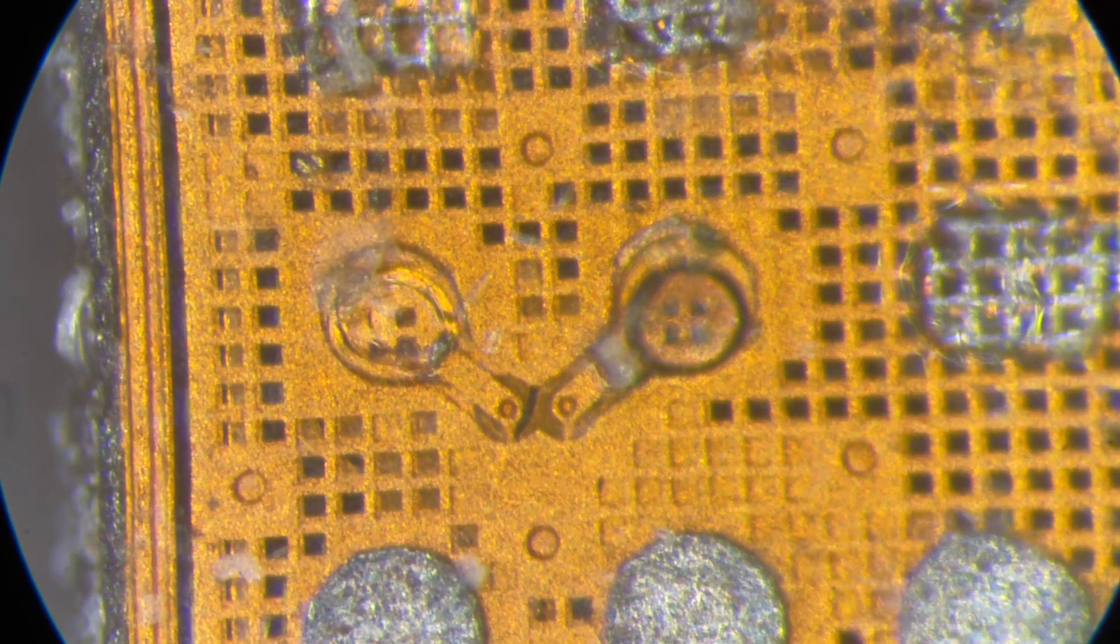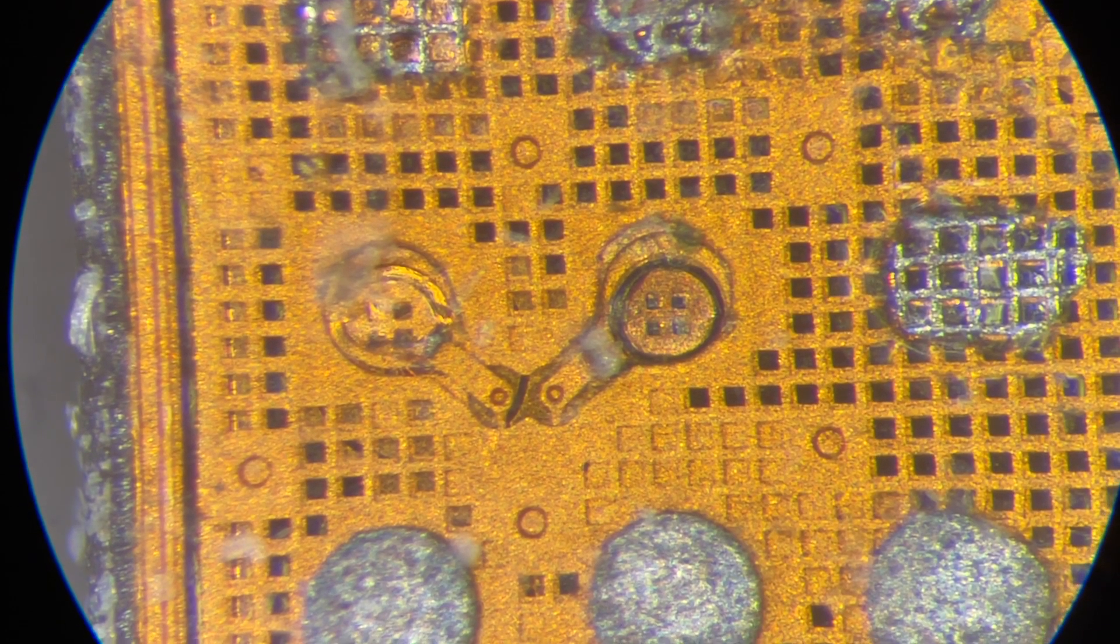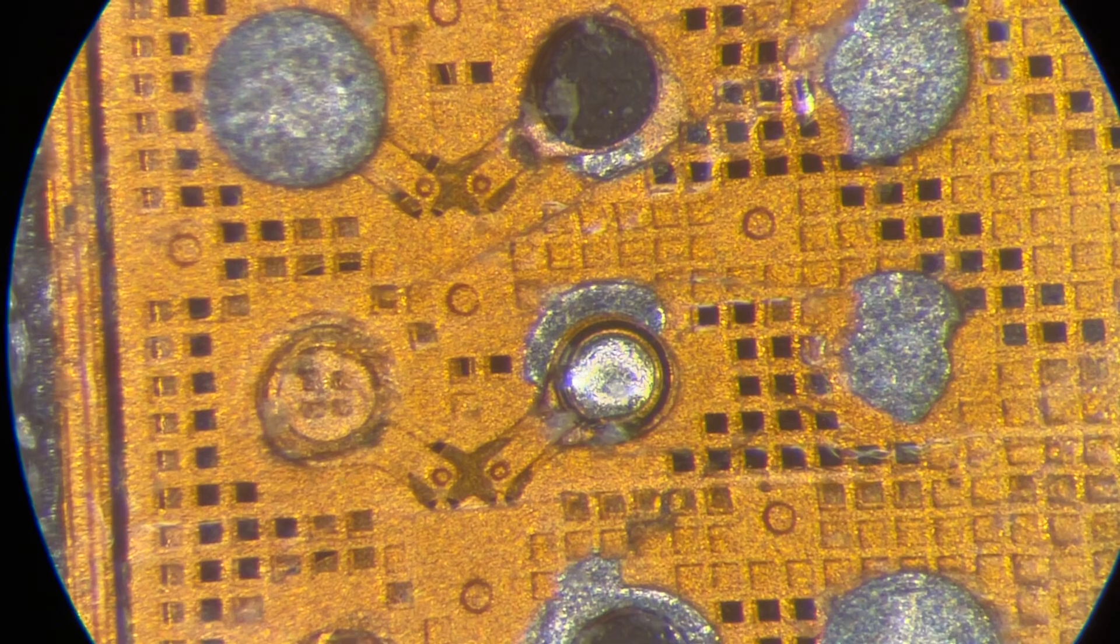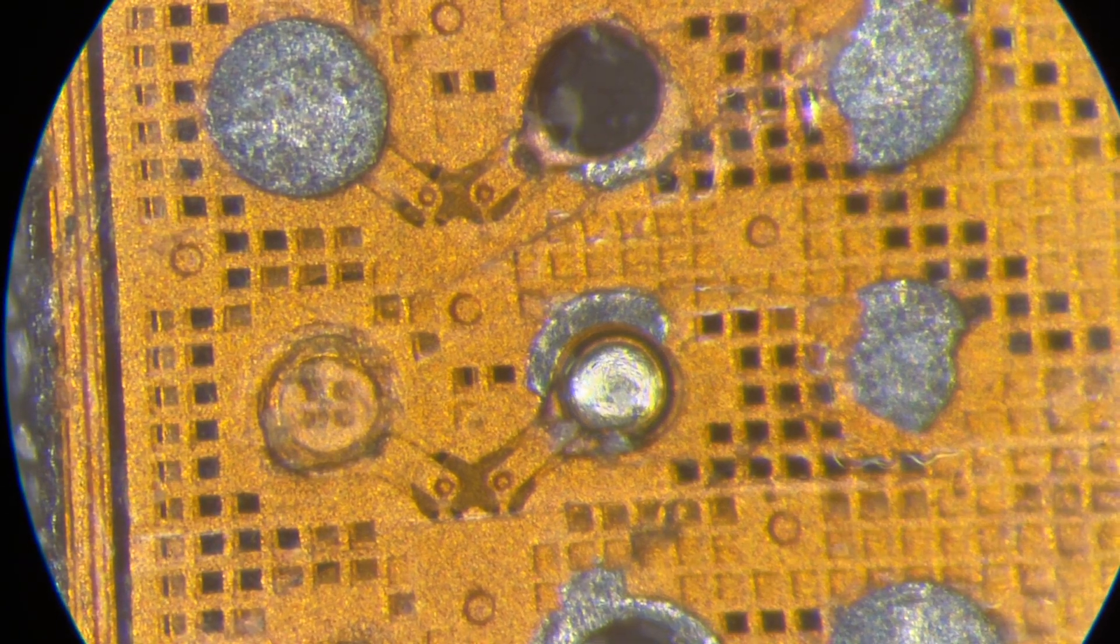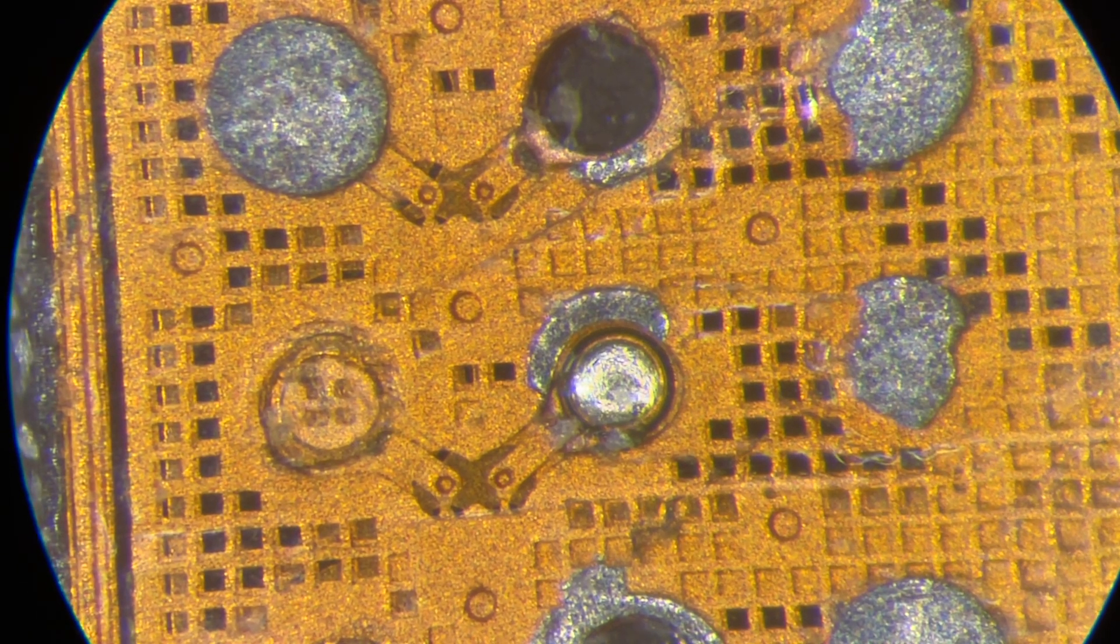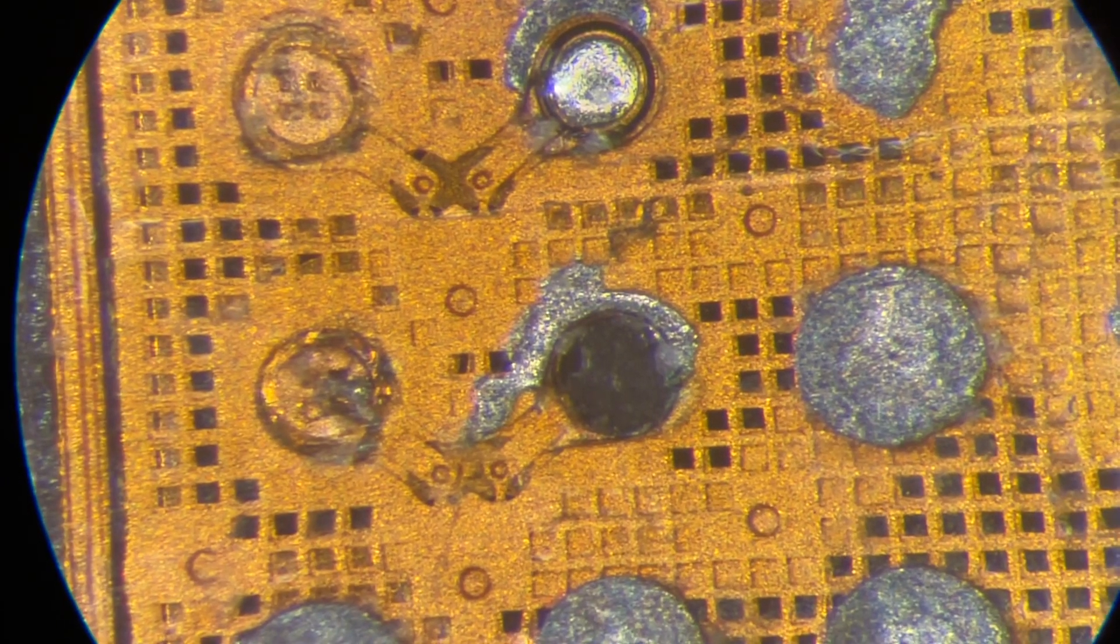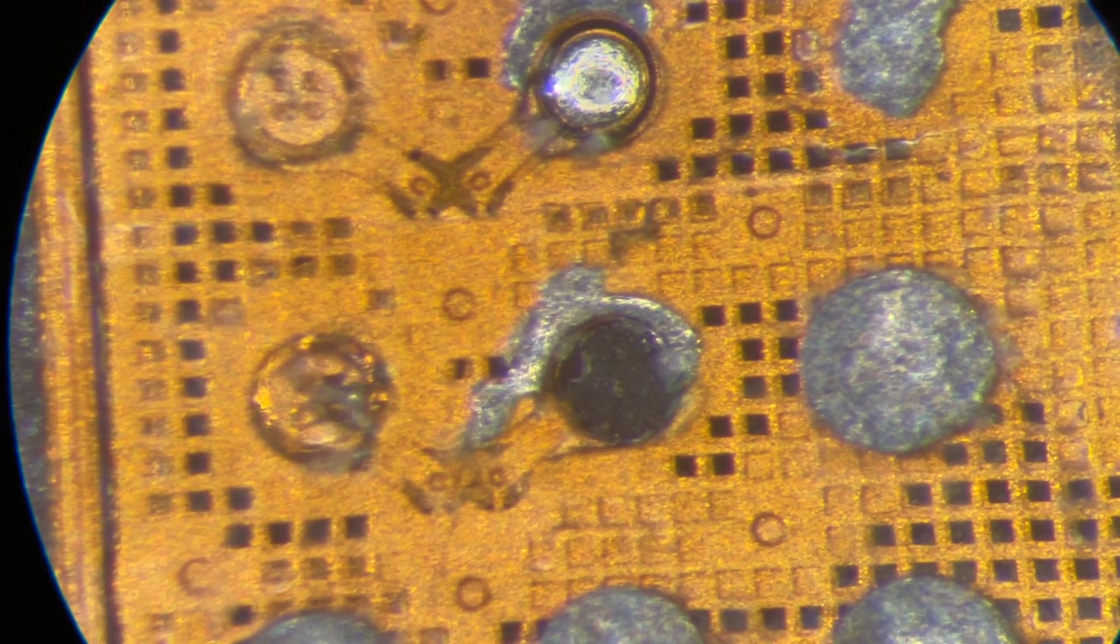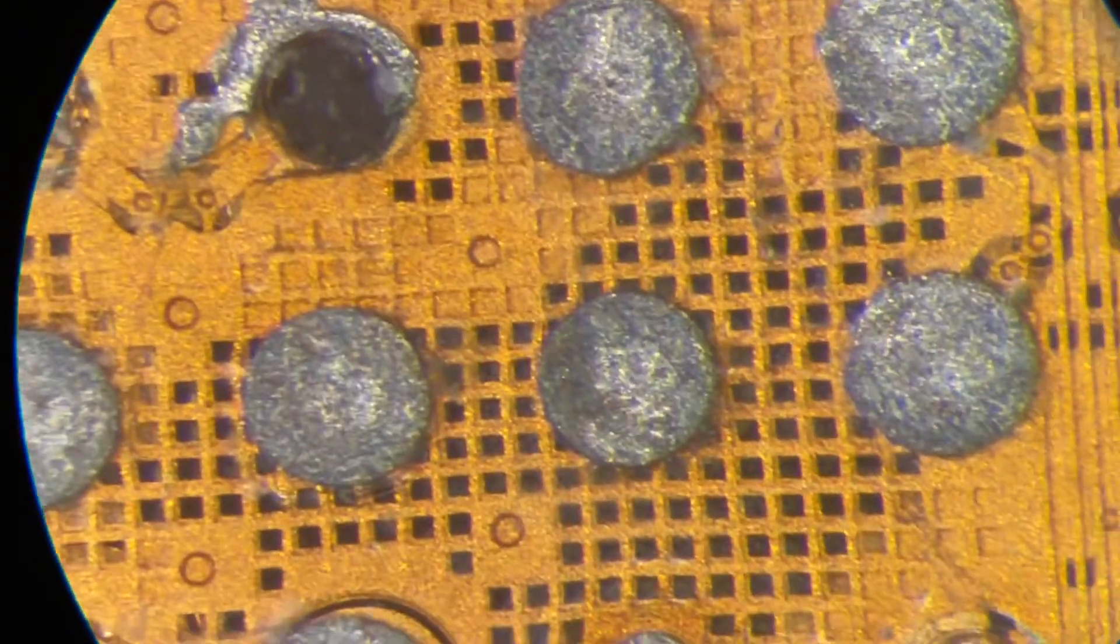I'm changing focus a bit while I move. You can notice that in our case there are obvious different depths of view and different depths of different layers here. When I move with focus, I can sneak lower then return to the usual surface height.